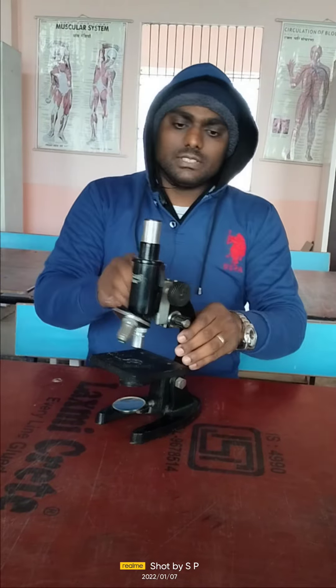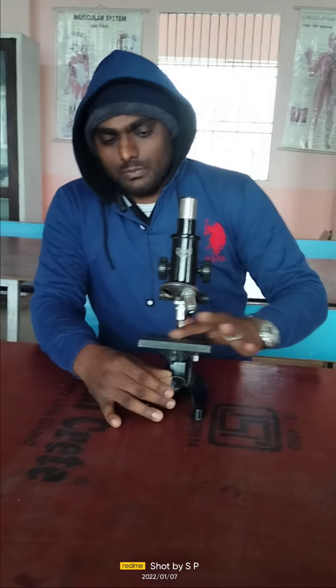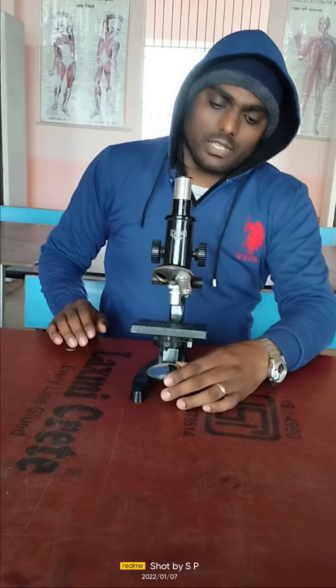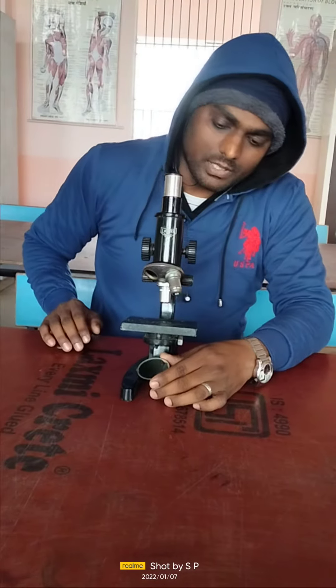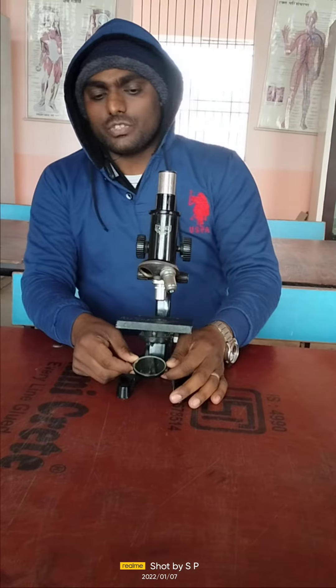This is also adjustable to adjust the light in a proper way so that it may be focused on the mirror, and after that the proper amount of light is focused on the specimen which we are going to observe under the microscope.